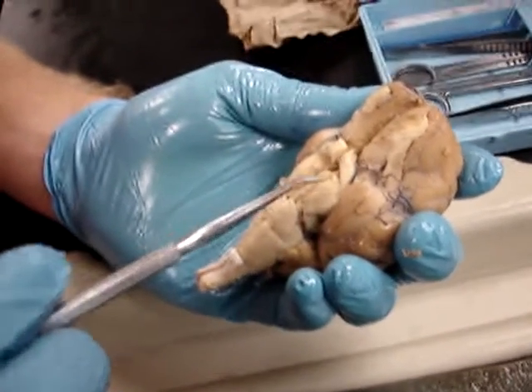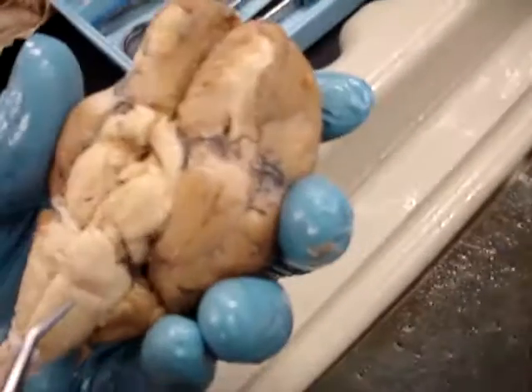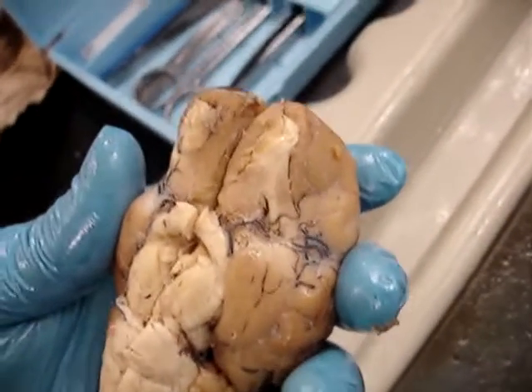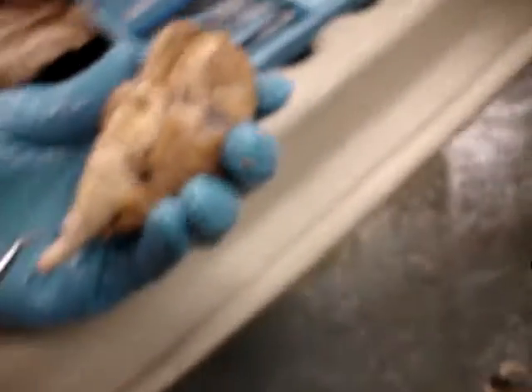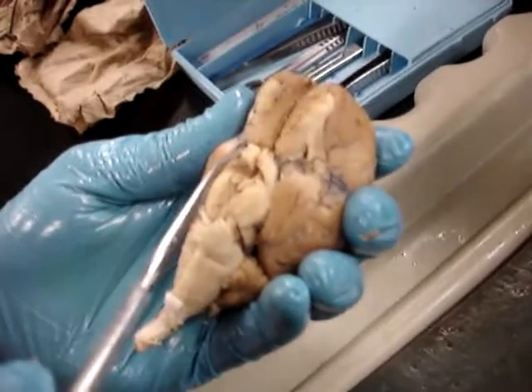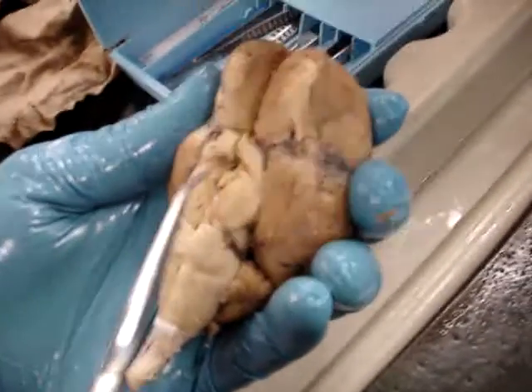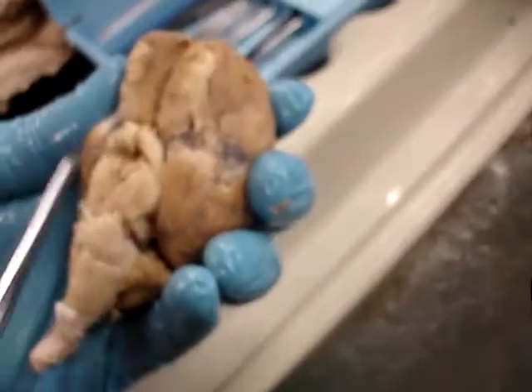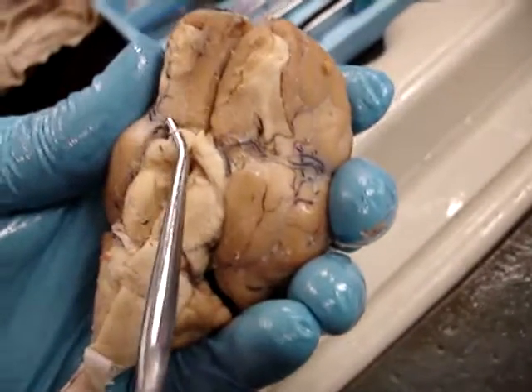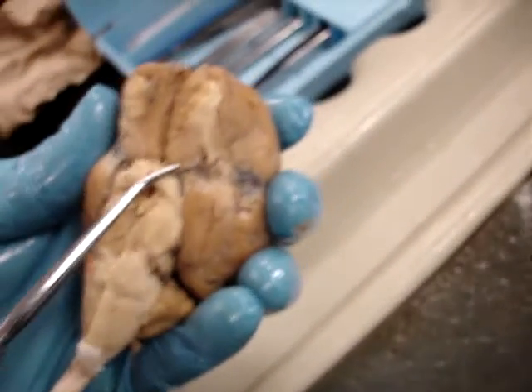The mammillary bodies are these two things — they're kind of torn up on this one. The optic nerve goes off from here. This is the optic chiasm — it usually forms an X shape. So the optic nerve would go off like right there and like right there.